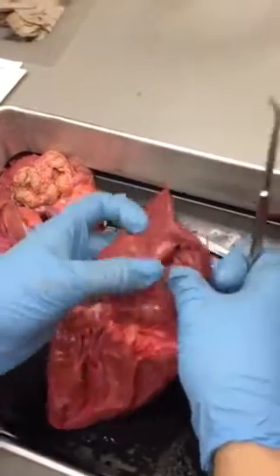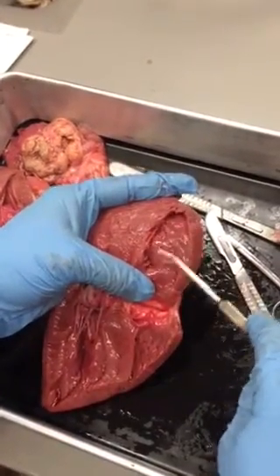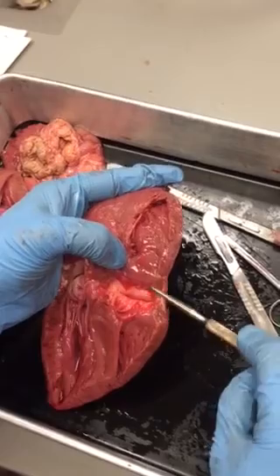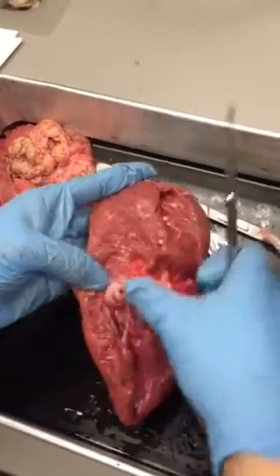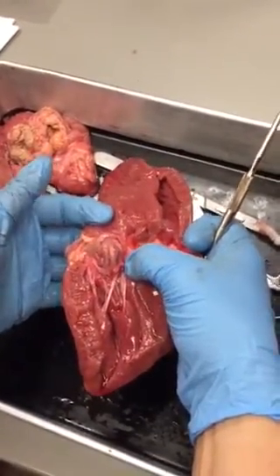You can also see some other muscle structures for the heart. These muscles that are found in the ventricles are called trabeculae carneae. And then these convolutions in the auricle are called pectinate muscles. You can see them best on this side of the heart. So these are your pectinate muscles.